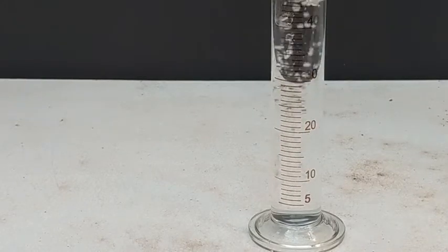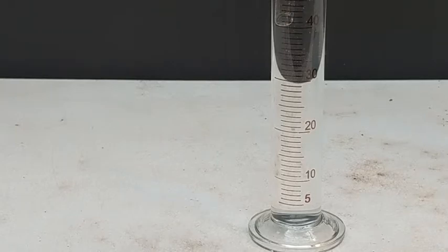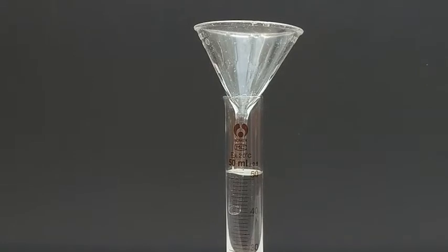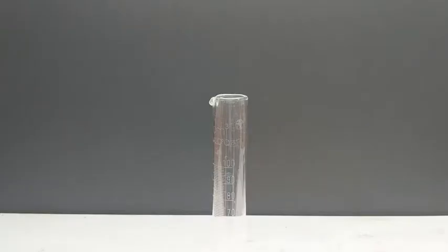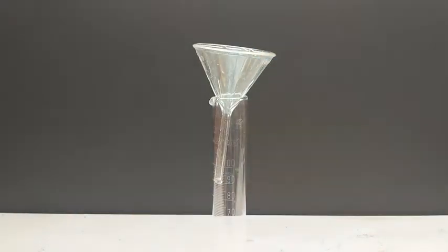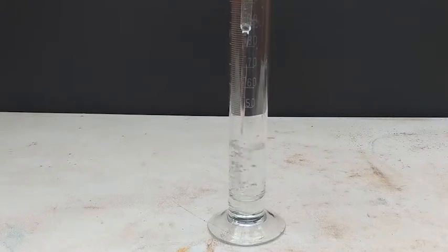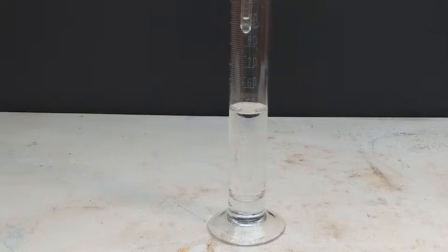We used the last bit of glacial acetic acid that we had left on hand — approximately 51 ml. We measured out about 45 ml of 29% ammonium hydroxide. The measurements we are using are quite arbitrary, which does not matter because we just need lots of ammonia gas. These are not accurate measurements.